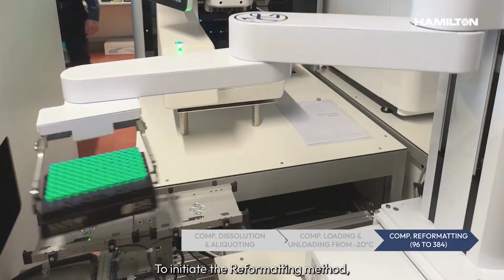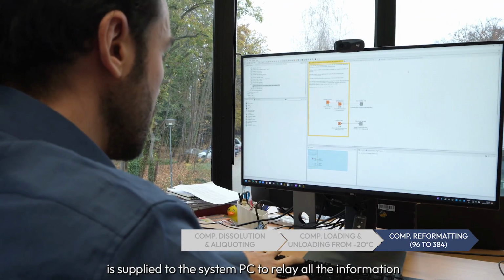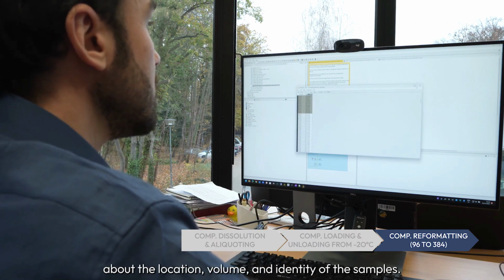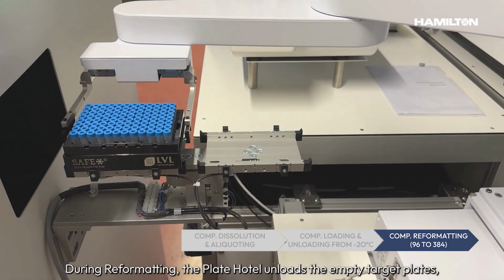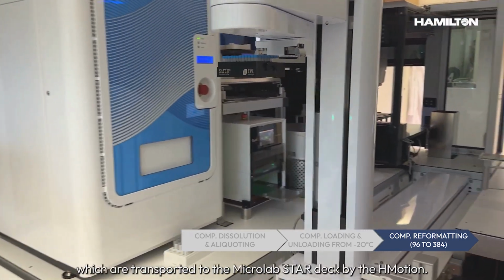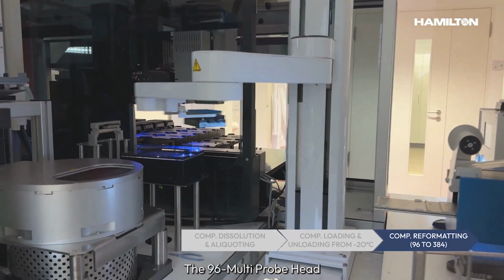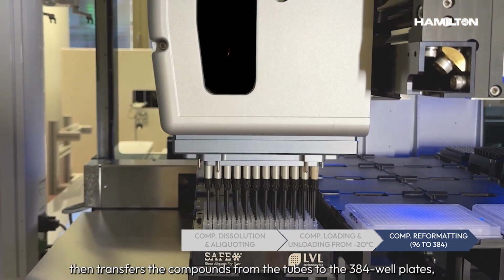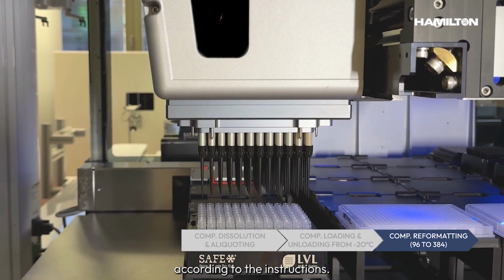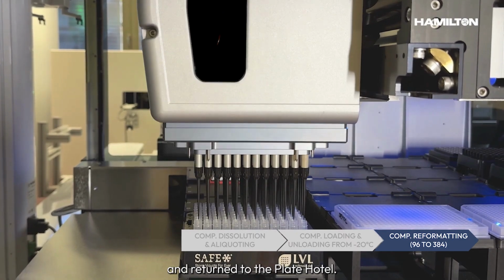To initiate the reformatting method, a CSV file edited by the NIME software is supplied to the system PC to relay all the information about the location, volume, and identity of the samples. During reformatting, the plate hotel unloads the empty target plates, which are transported to the Microlab Star deck via the H-Motion. The 96 multi-probe head then transfers the compounds from the tubes to the 384 well plates according to the instructions. After the transfer, the tubes are recapped and returned to the plate hotel.